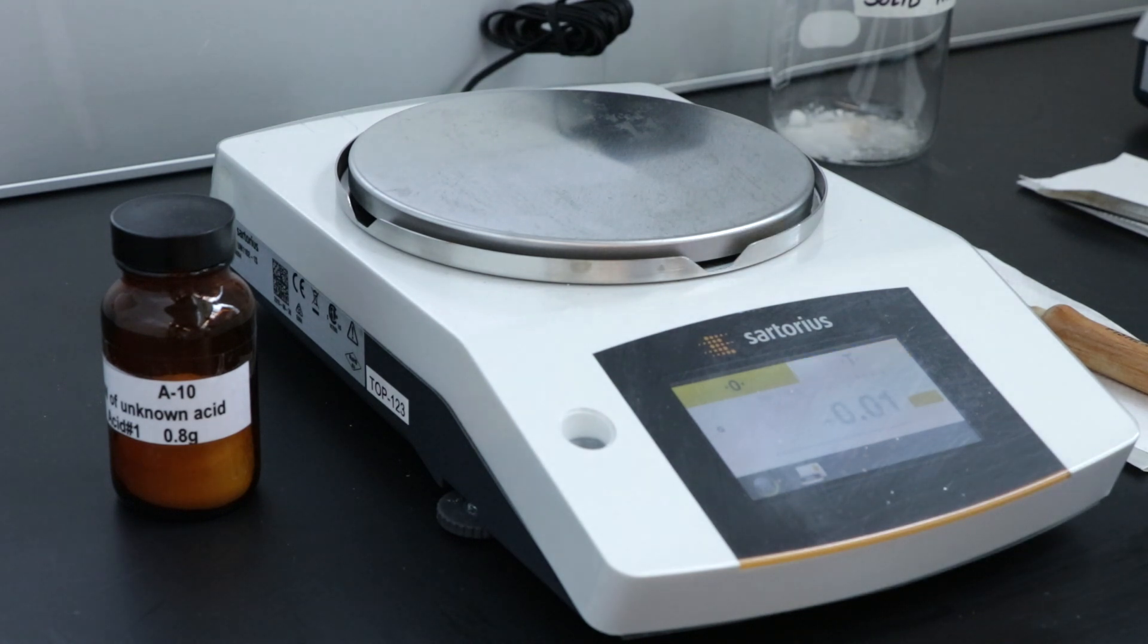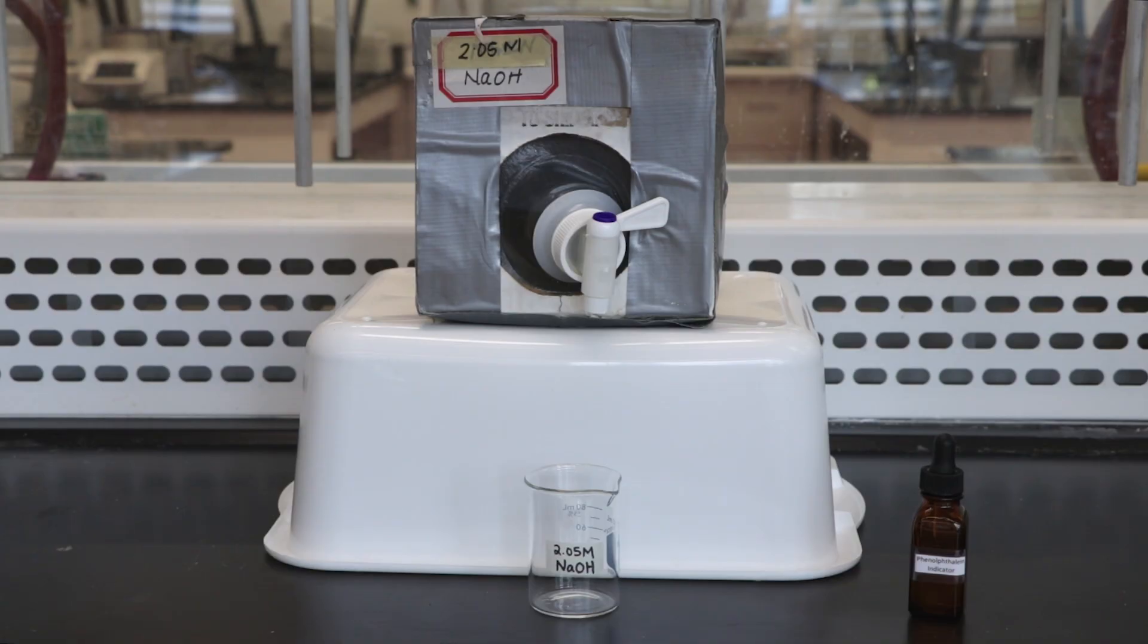All chemicals needed for this lab can be found either in the TA fume hood or by the top loading balances. Remember to take note of the concentration of sodium hydroxide provided in your lab.